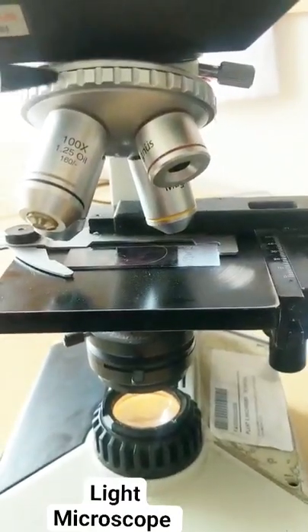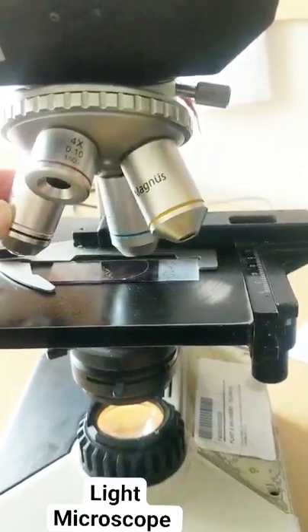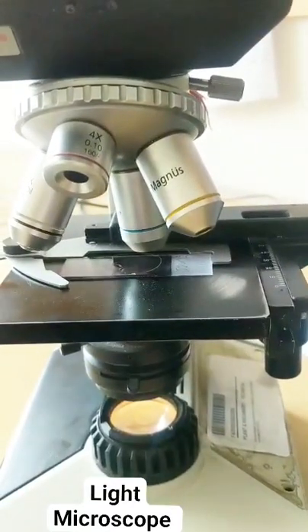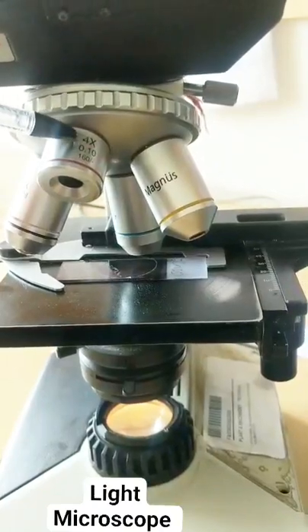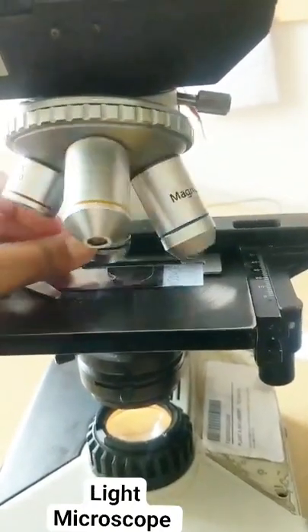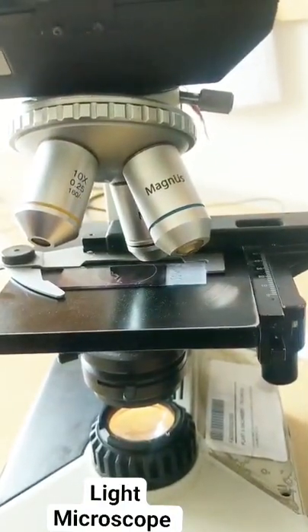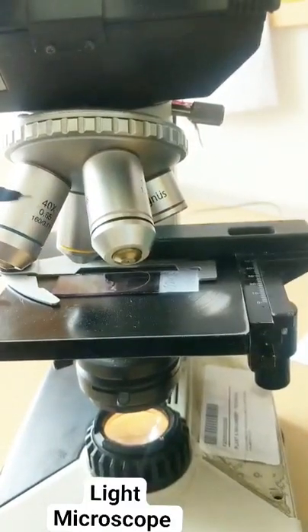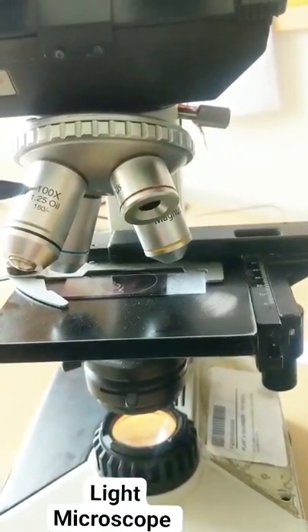What is the first set of lenses that you have? Do you notice this set of four lenses? These are the objective lenses. Let's see what's written on them. On this tiny objective lens you have 4x written — so this is 4x magnification. On the next one you have 10x written. Further, you have 40x written.